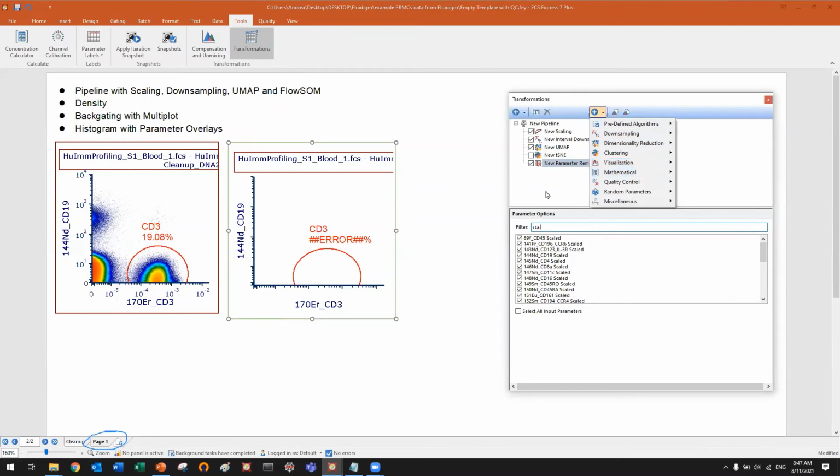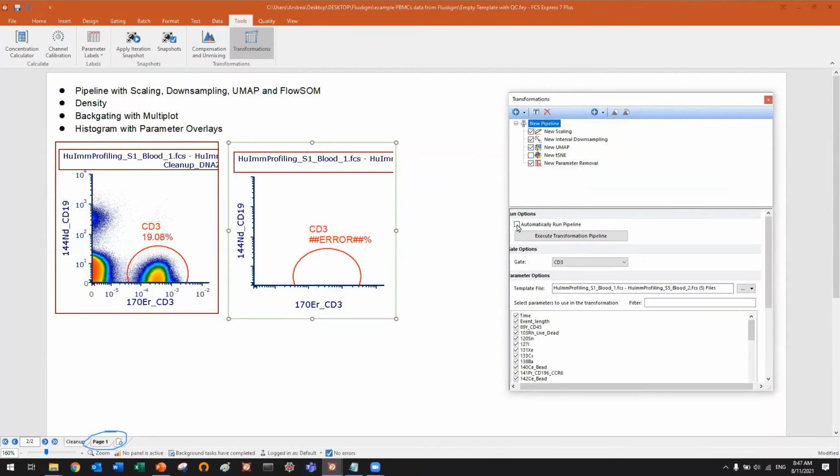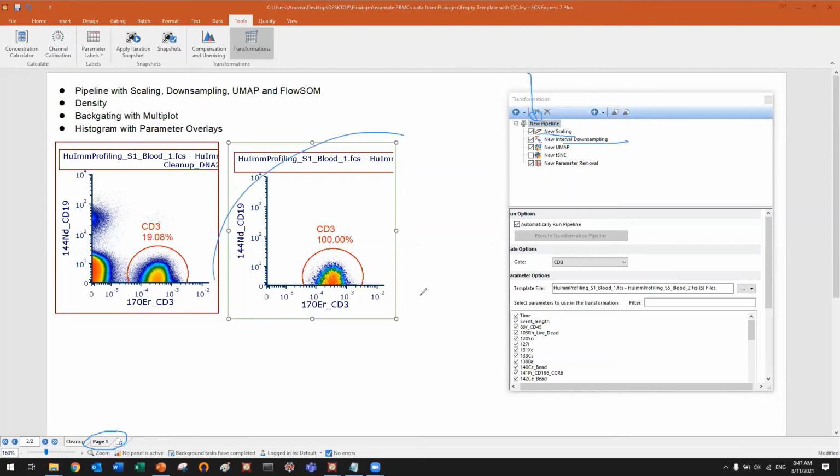Let me just go back and reactivate the live update. The pipeline will now be calculated, and it will go from the top to the bottom. The input data will be scaled, then it will be downsampled. You see it's already done. Then it will be UMAPed. t-SNE will not be run because we didn't check it, and then parameter removal.